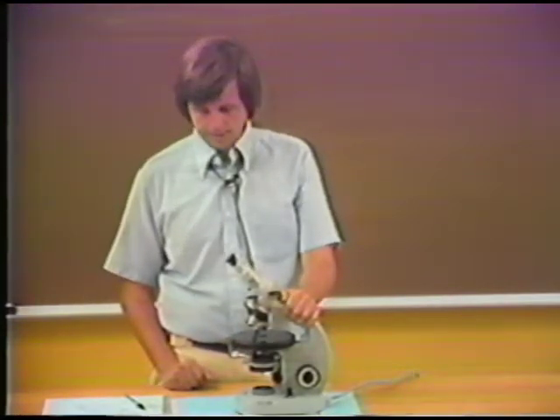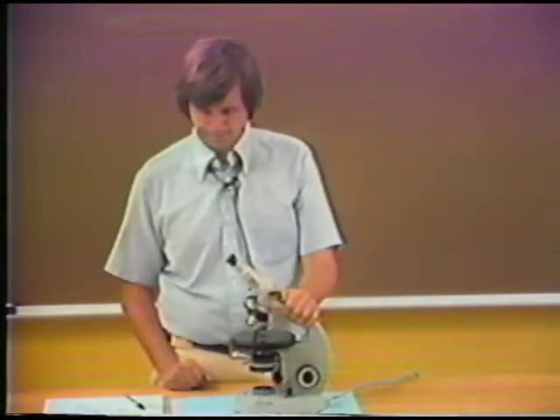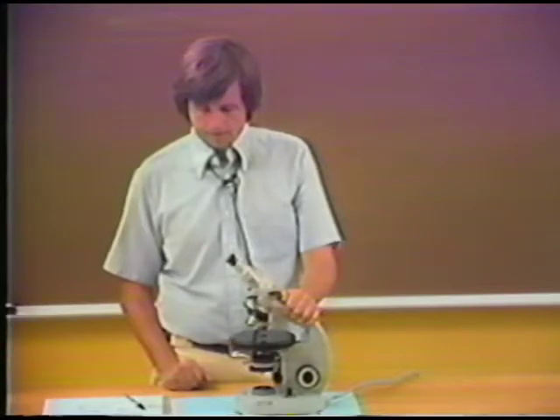Instead, we have to know whether we're looking at the ordinary ray or the extraordinary ray in the case of uniaxial minerals. And we can't do this in orthoscopic view. This is one of the main advantages that conoscopic view gives us. And that's something we'll be talking about next time. Evaluating relief of anisotropic, in particular uniaxial minerals, we'll speak about in the next tape segment.